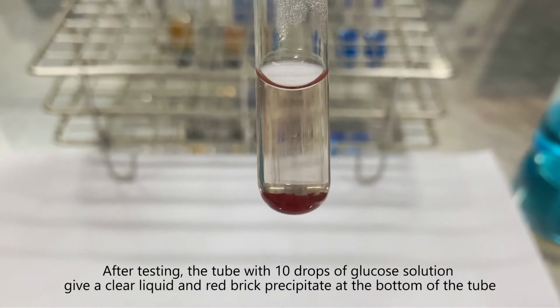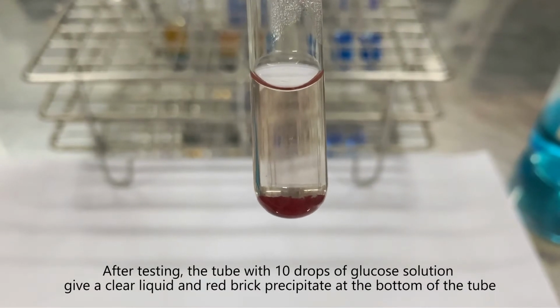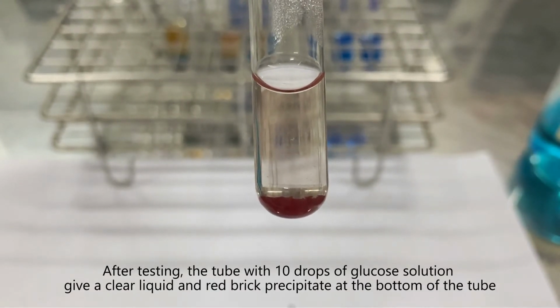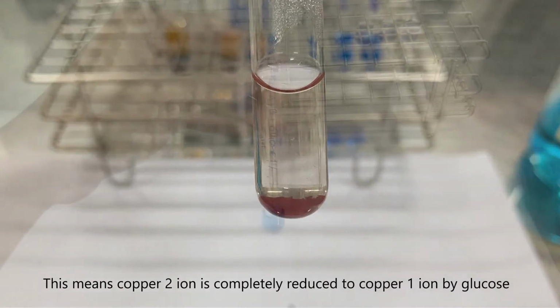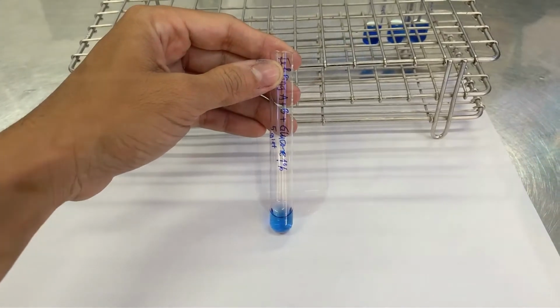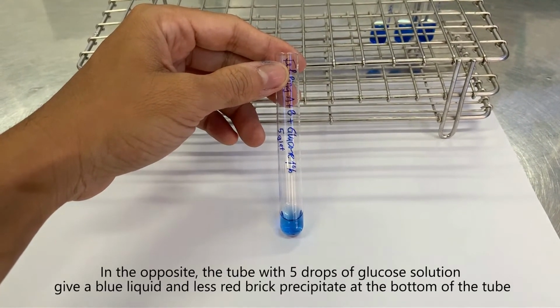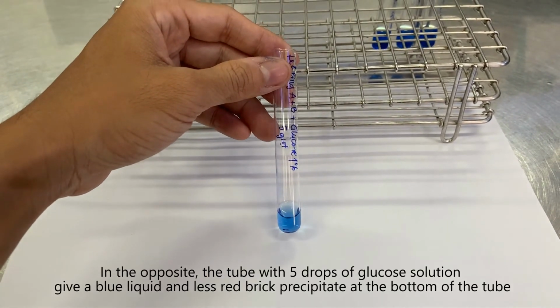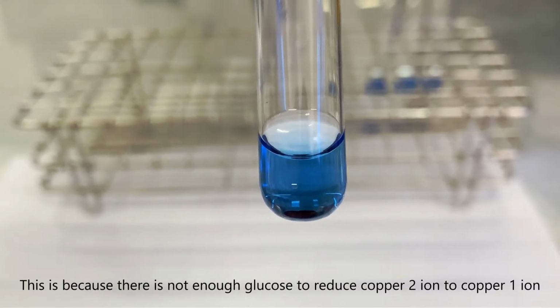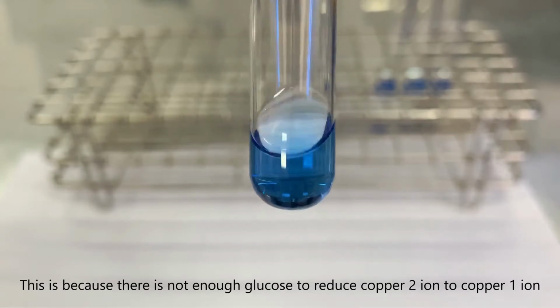After testing, the tube with 10 drops of glucose solution gives a clear liquid and red brick precipitate at the bottom of the tube. This means copper(II) ion is completely reduced to copper(I) ion by glucose. In the opposite, the tube with 5 drops of glucose solution gives a blue liquid and less red brick precipitate at the bottom of the tube. This is because there is not enough glucose to reduce copper(II) ion to copper(I) ion.